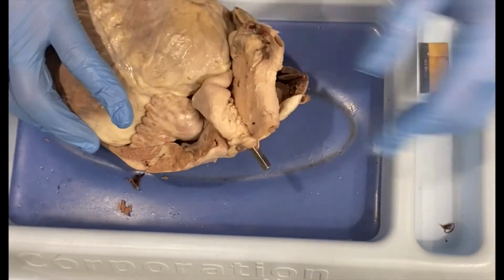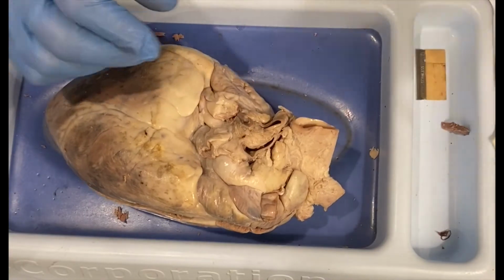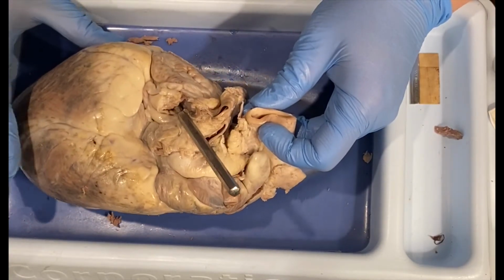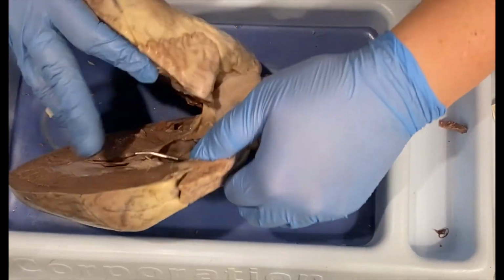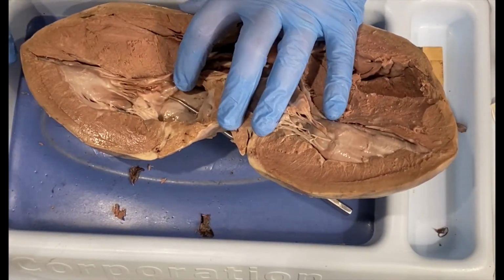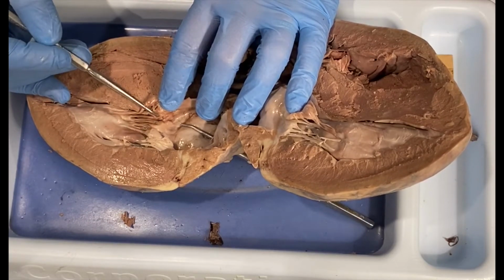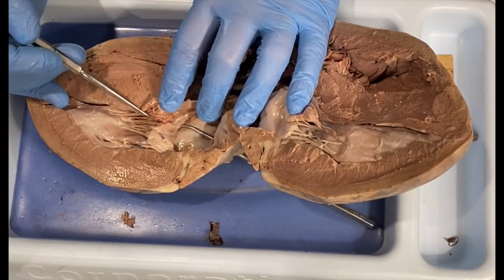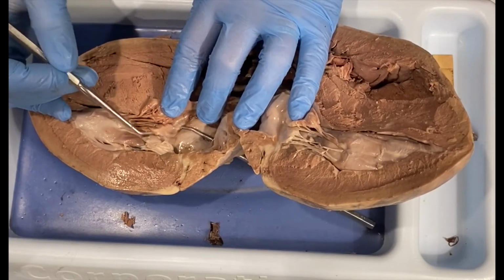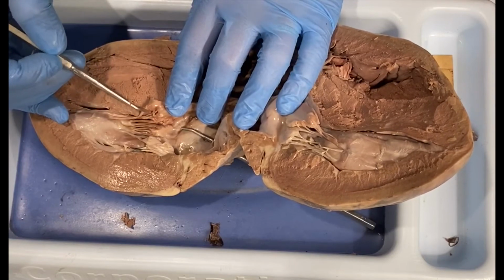Then that blood is going to travel to the lungs, pick up oxygen, drop off that carbon dioxide. It will come back through the pulmonary vein, which is this guy right here. If I put my probe in that particular opening, you will notice that it comes directly into the left atrium, and from the left atrium, it is going to go into the left ventricle, which the valve that separates the left atrium from the left ventricle, the technical name is the left atrioventricular valve, or the left AV valve. This also gets the name bicuspid because it's got 2 flaps to it instead of 3, and it is also referred to as the mitral valve.